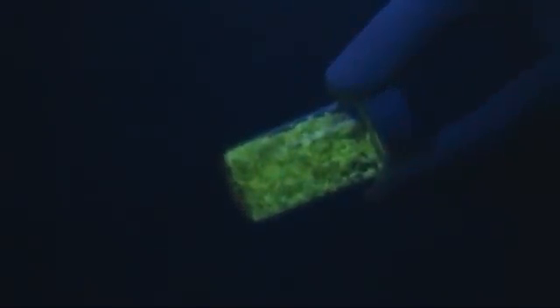Seeing a green fluorescent substance is nothing new. You can buy all kinds of products that fluoresce in all sorts of colors. However, there's something satisfying about making your own glow compounds.